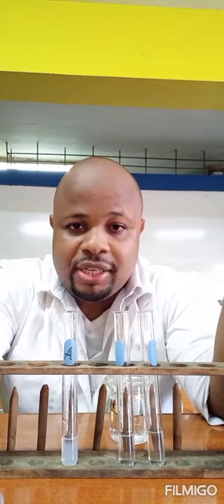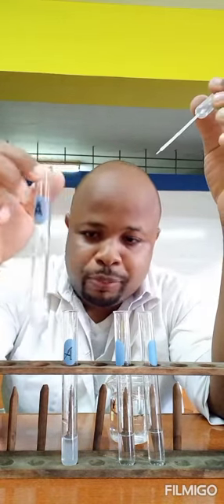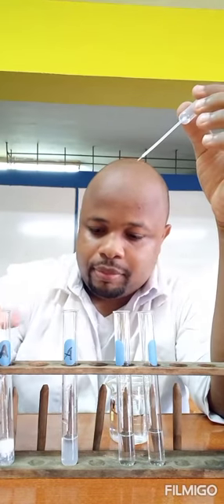If it's a white precipitate, it could be a number of ions: lead, zinc, magnesium, calcium, or aluminium. So we add it drop-wise, and any of those ions could have been present.